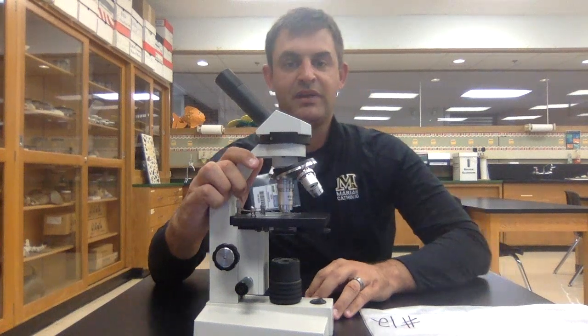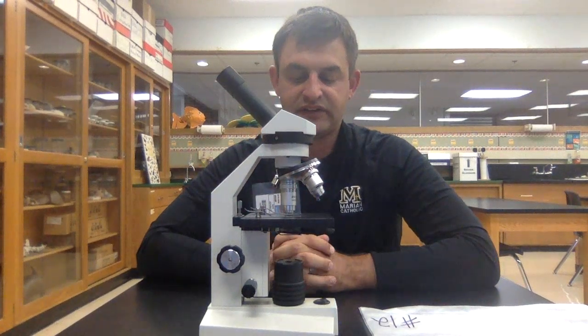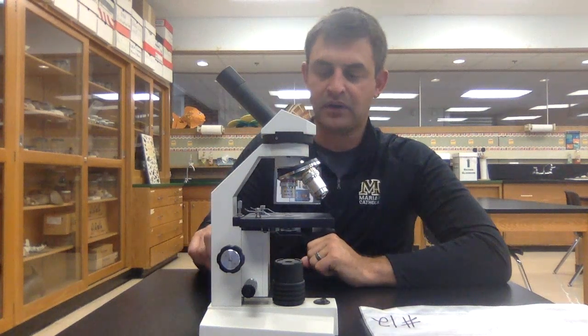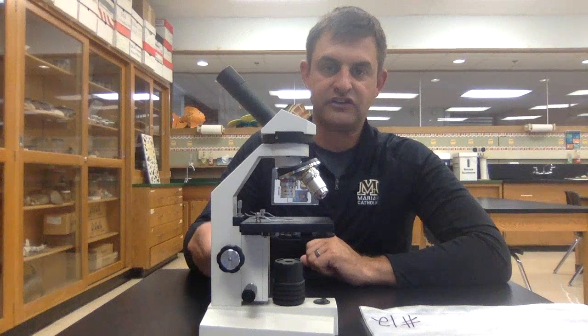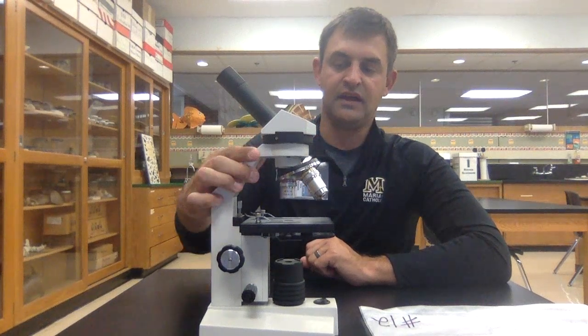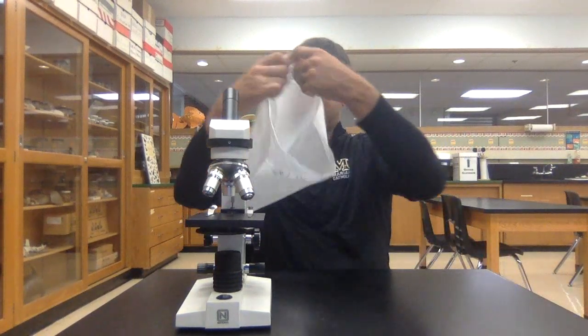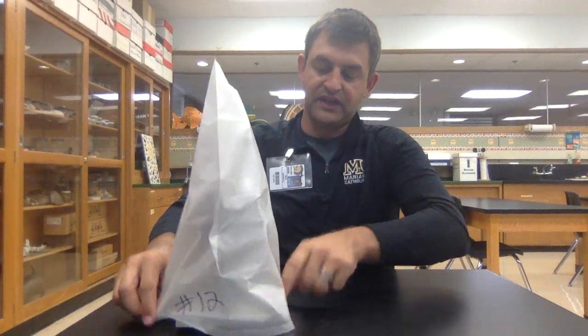When you are done with your microscope, you need to prepare it for the next person. Turn the knob back to scanning power and lower the stage all the way down — the next person is going to want to put a specimen on there. Then your last step is to put the plastic cover over the microscope, even if it's just between class periods, to make sure no dust is getting onto those lenses. Hope this was clear. If you have any questions, you can ask me or your biology teacher. Take care.